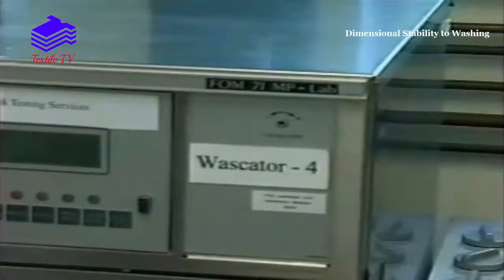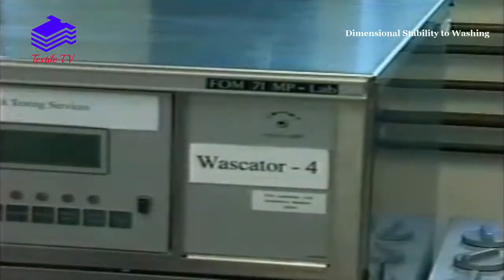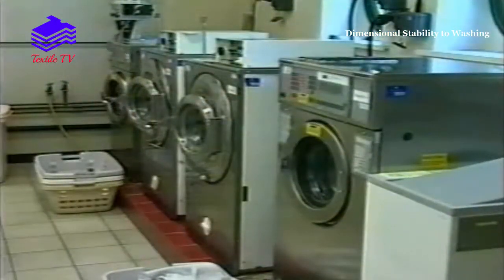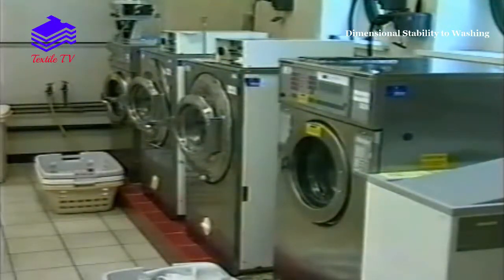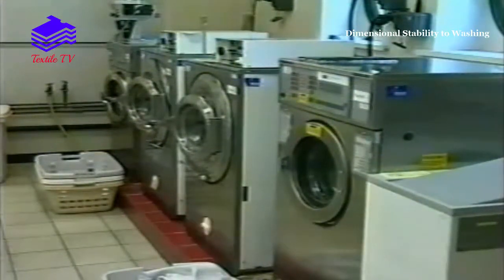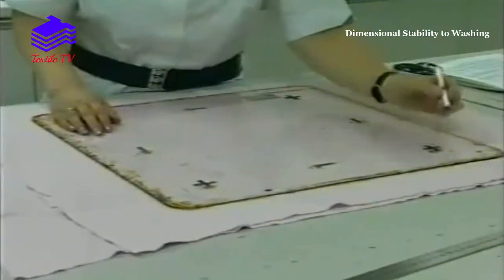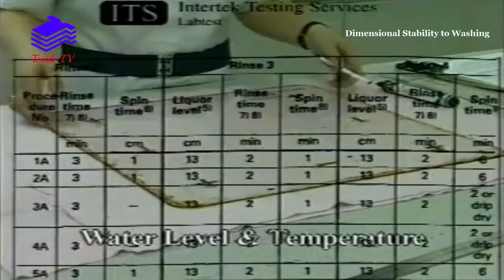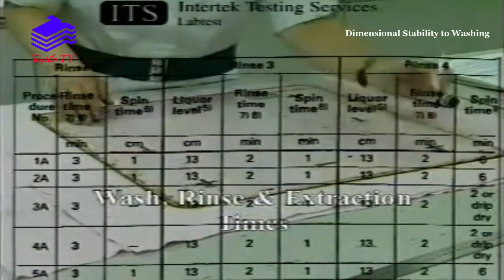In order to assess this property, a series of washing programmes have been developed and standardised using the Wascator washing machine. The stability of textile fabrics is determined by washing a prepared specimen in a standard Wascator washing machine, using a specified set of conditions covering washing action, water level and temperature, wash, rinse and extraction times.